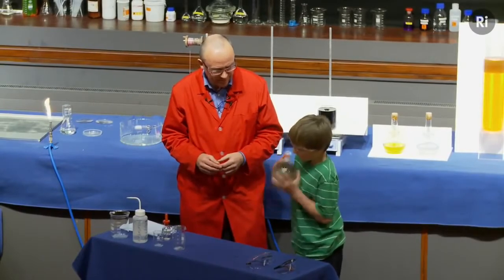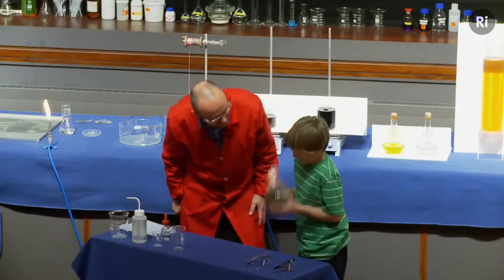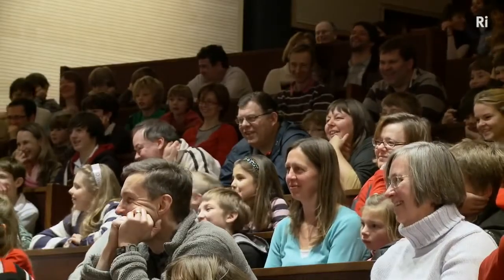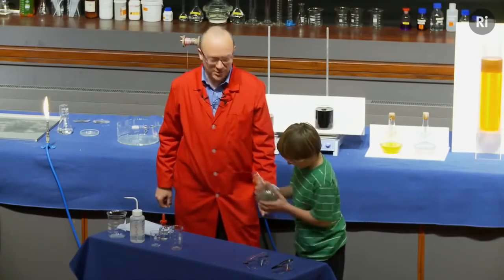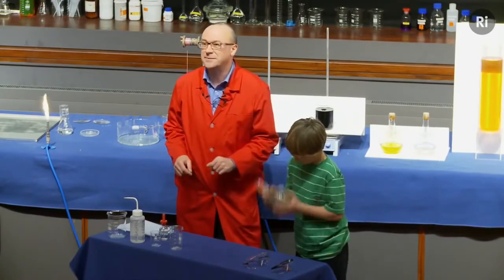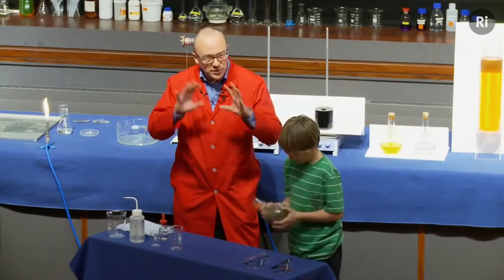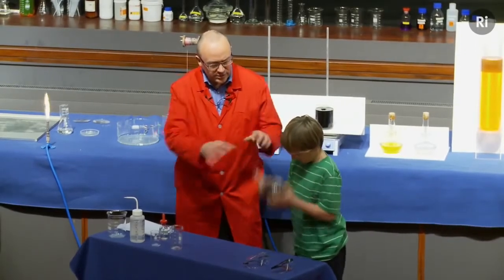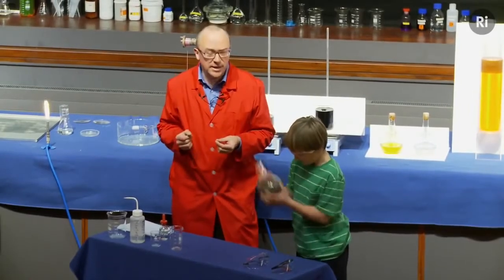Keep shaking. It takes about three quarters of an hour. Is that okay? It does actually take a minute or two, but the harder you shake, the better it works. So keep shaking. Don't drop it, though. Okay. So silver metal is being formed sort of atom by atom, and you can see it's all going quite black. That's because very finely divided silver is actually black in colour.